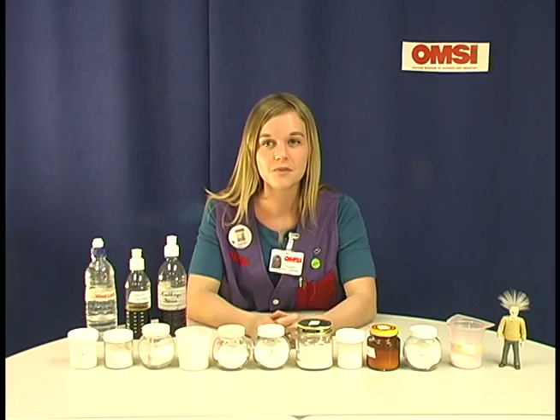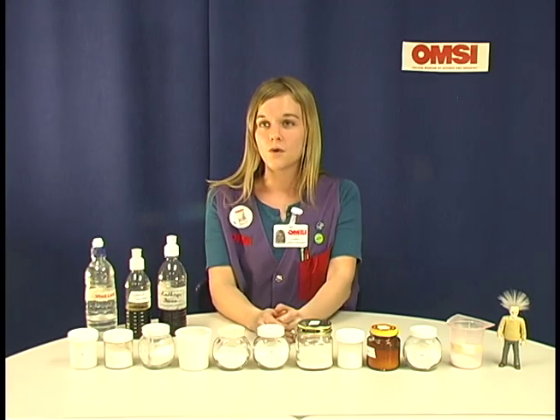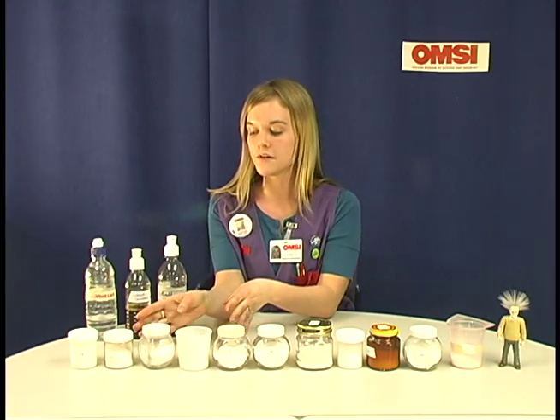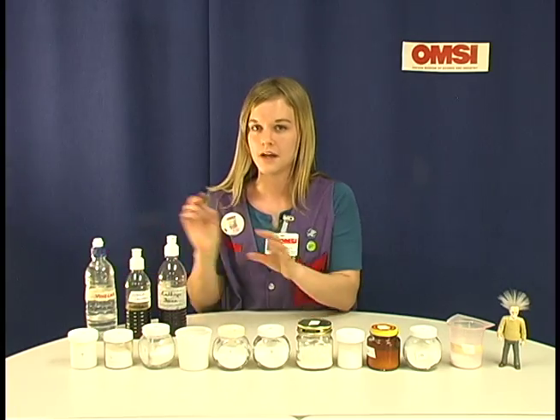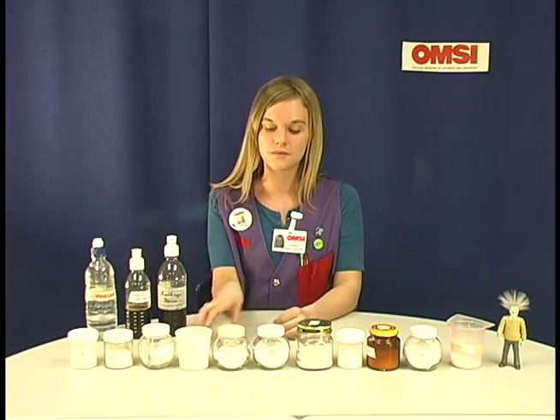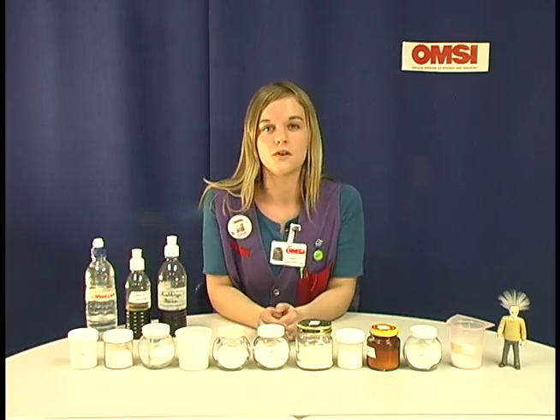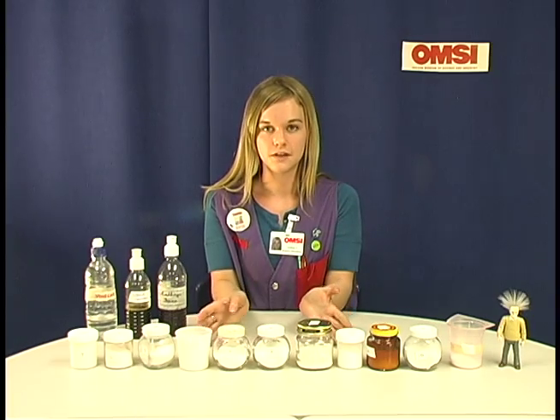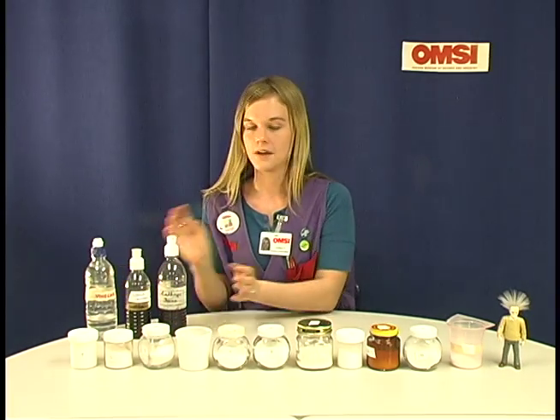For your class setup you can either have rotating stations where each station has a few of the unknown powders as well as the indicators and students switch from station to station, or you could have each group of students have all 12 powders and 3 of the indicators.